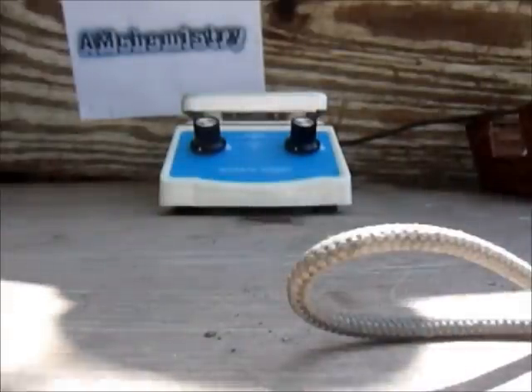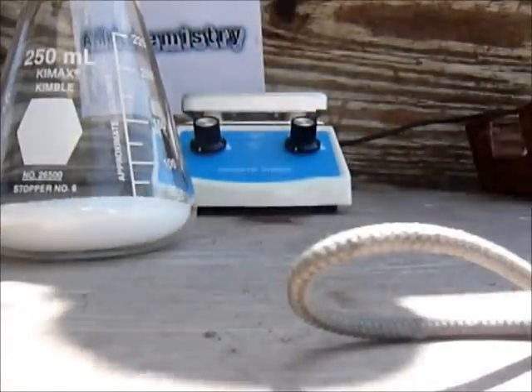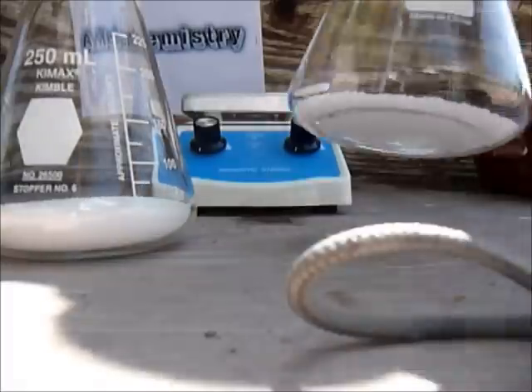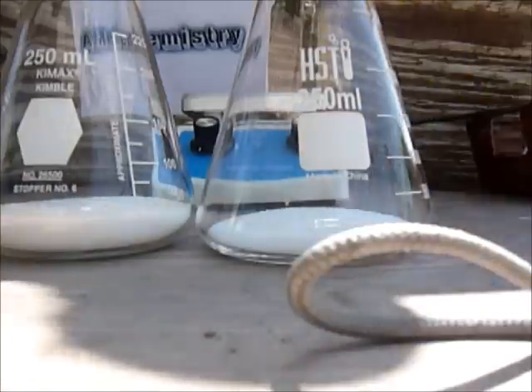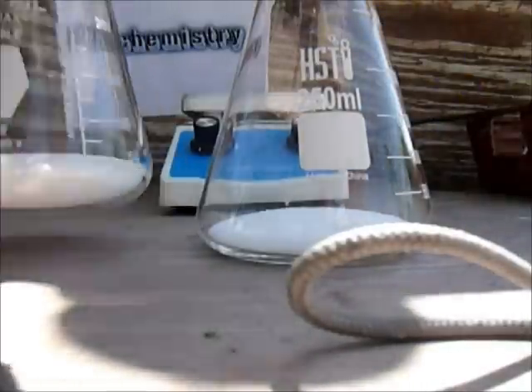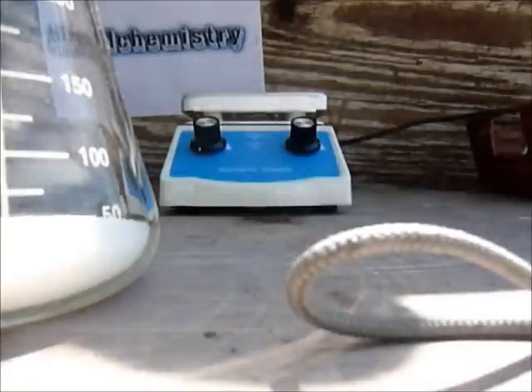You will be needing 70 grams of sodium bisulfate and 30 grams of sodium chloride. You will have to turn on your heating on high and mix the chemicals together. So that's what I will be doing right now.